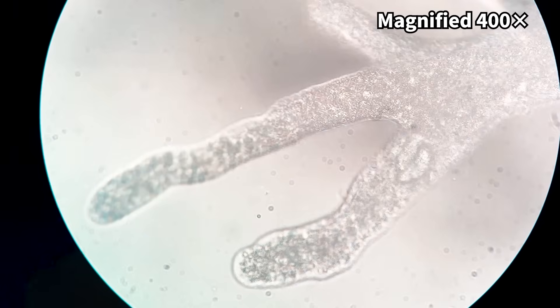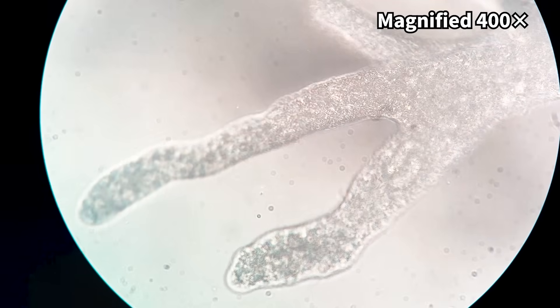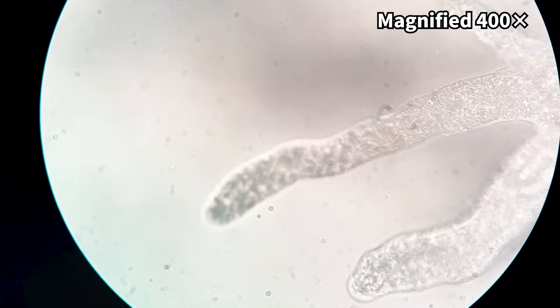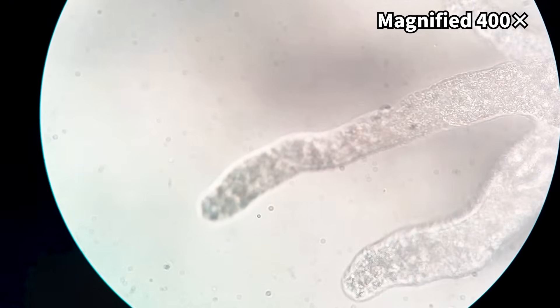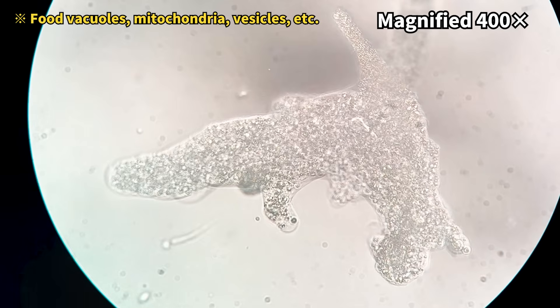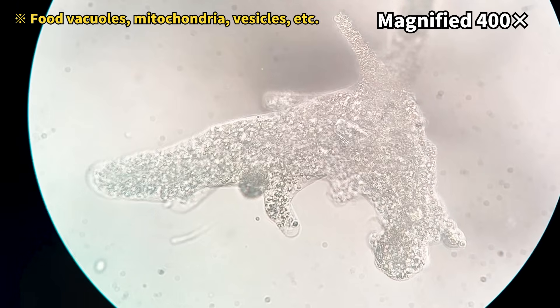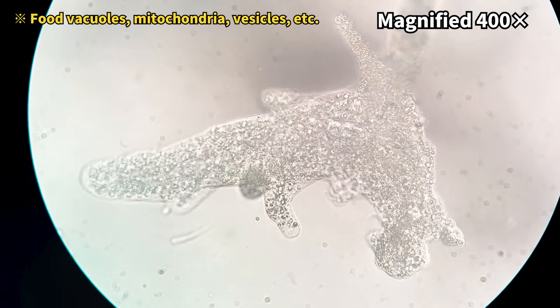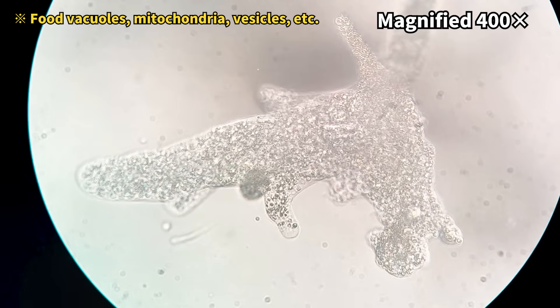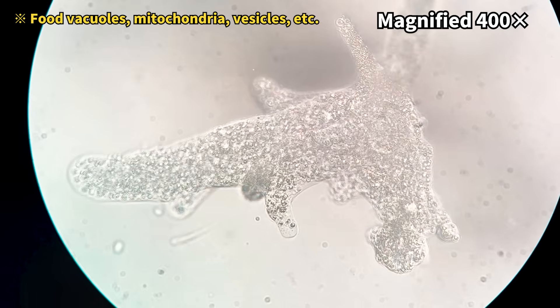Slowly digesting it as they absorb it. When we zoom in even further, we can see that the amoeba's body is transparent, so you can actually see particles, organelles, and even the food it's digesting inside its cell.